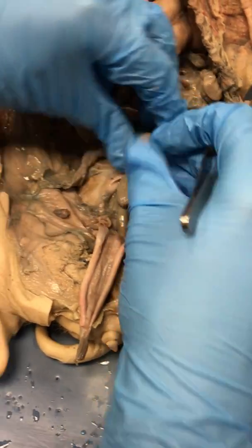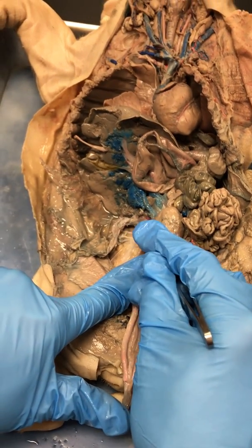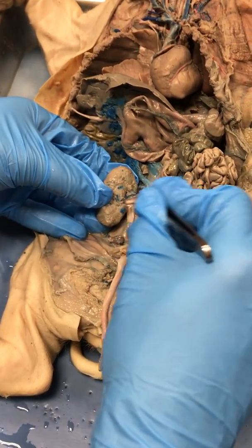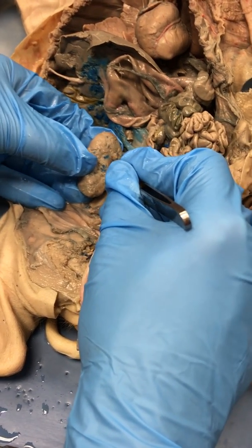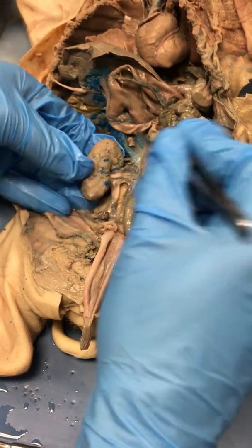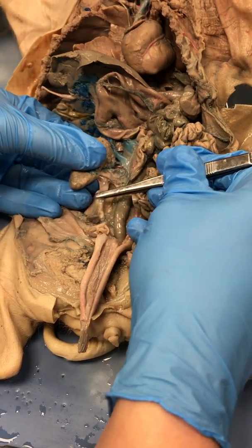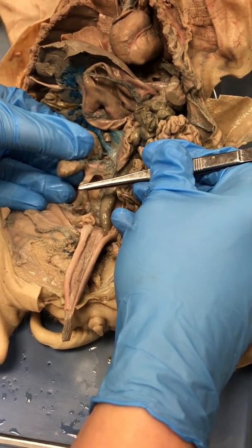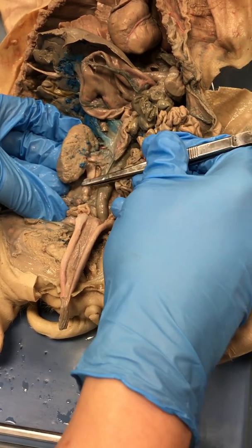So blood has to get to my kidney. If I flip my kidney over, I see I've got an artery going into my kidney right there. That is my renal artery. If I flip my kidney back over, I see I've got a blue thing going in my kidney. This is taking blood out of my kidney that has already been filtered. That is called my renal vein. Very good. Now, as my kidney filters blood, he produces urine. The urine has to get out of my kidney some way, and I've got a tube for that. The tube that drains the urine out of my kidney is called my ureter.